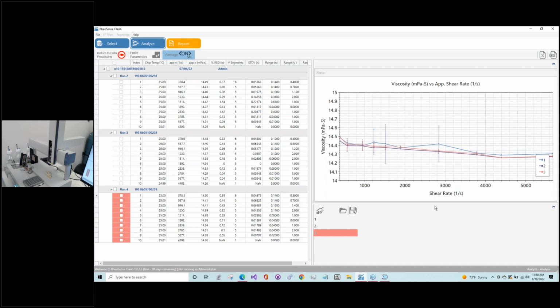And also, if you are doing multiple vials, you want to see, is it consistent? You wouldn't want to see this rate sweep profile bouncing up and down on the viscosity axis. It should be consistent within reasonable error as well. And that'll help you understand how the flow channel is doing, if it's getting deposits. If it's not, this will reinforce that everything is okay.